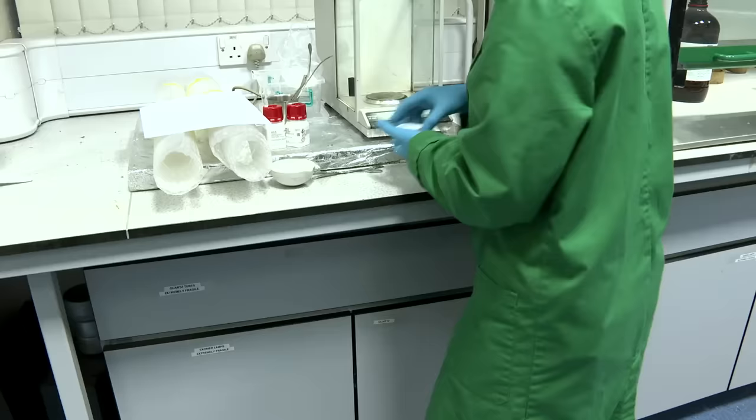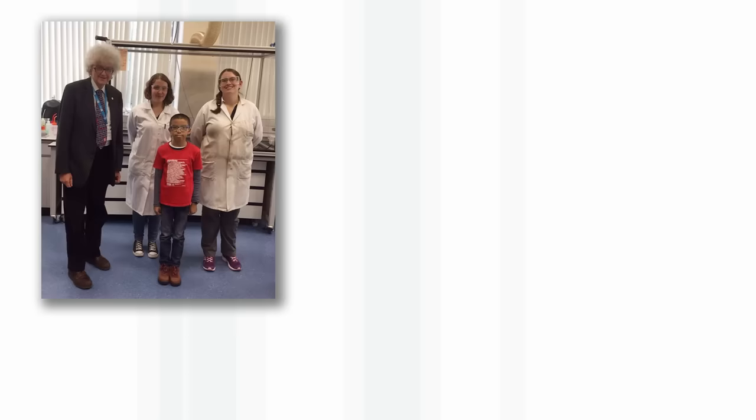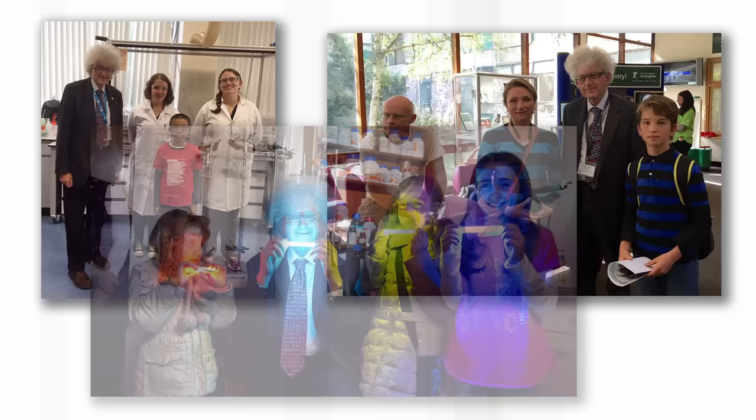Now I'll transfer these to the fume hood. Before we look at the details, let me just take you back to the start.